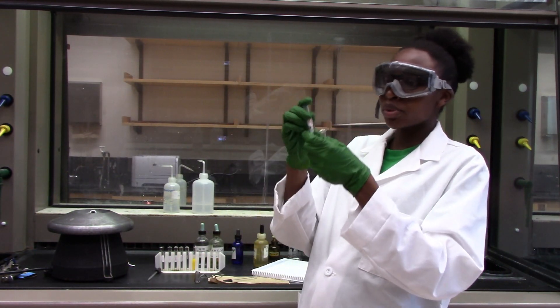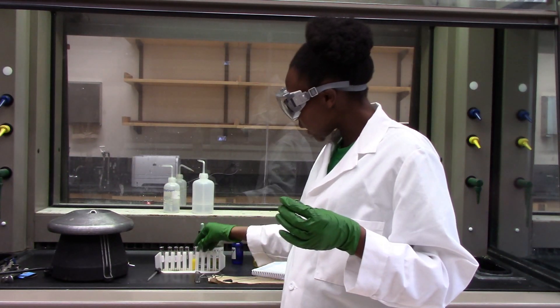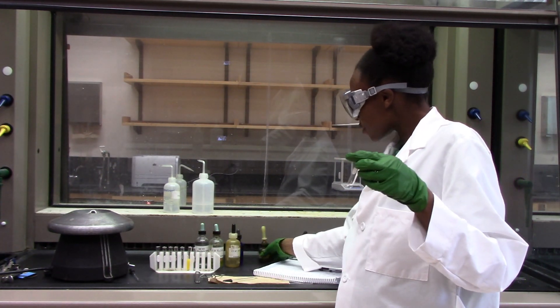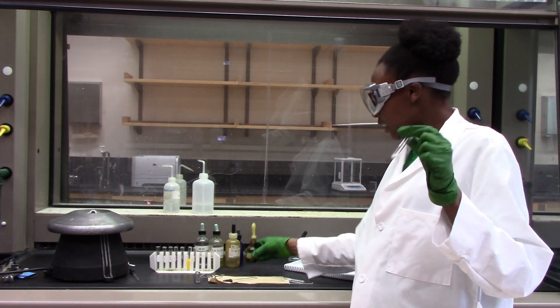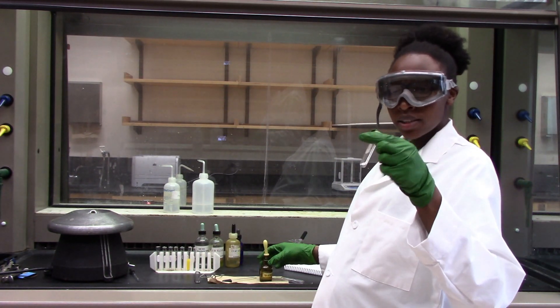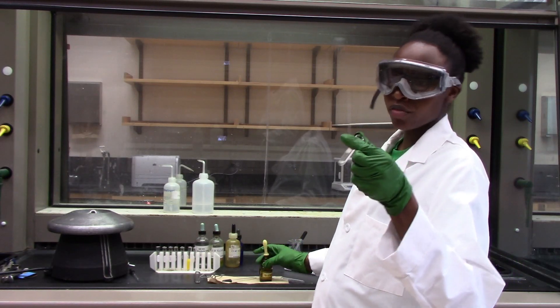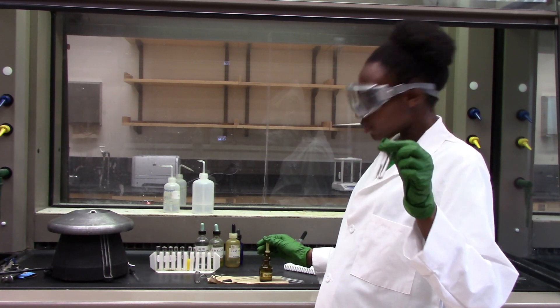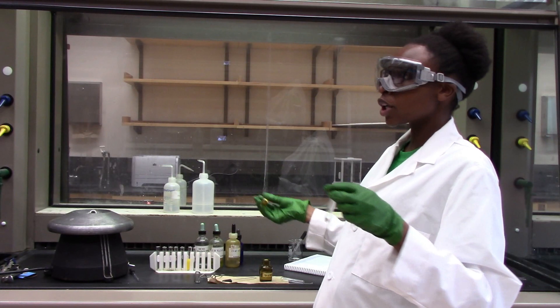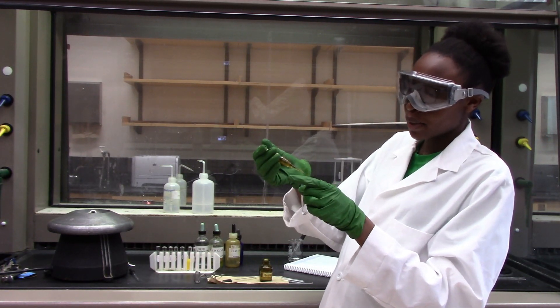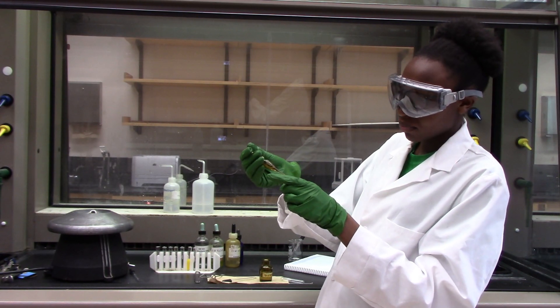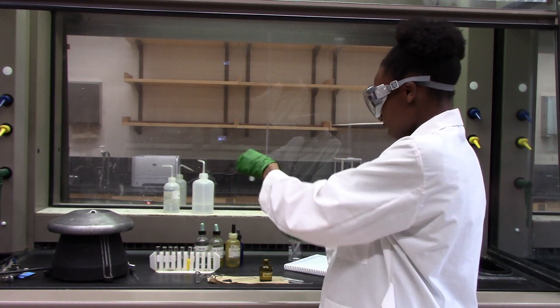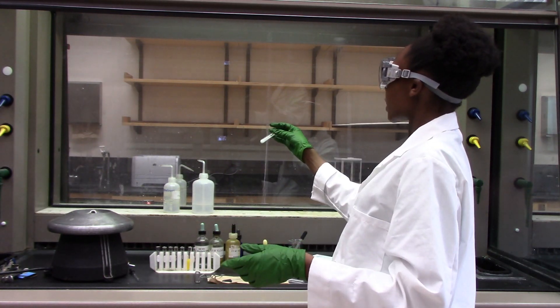Right now I can put aside my precipitate from step 3, but I need my supernatant for step 4 to confirm if there's any silver ions remaining in this solution. If I have another white precipitate, then that's a confirmatory test for the silver cation. If it doesn't, then there's no silver. I'm going to put 16 drops of nitric acid. I'll do this in the hood just because this fuming and gas is here.